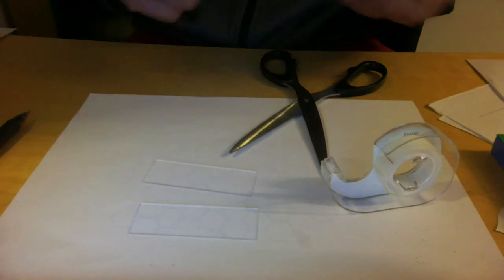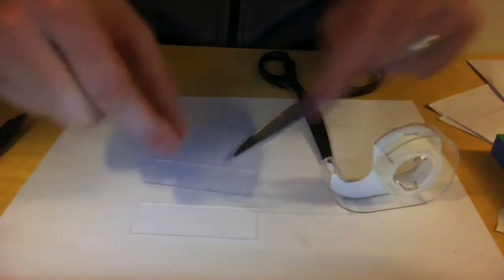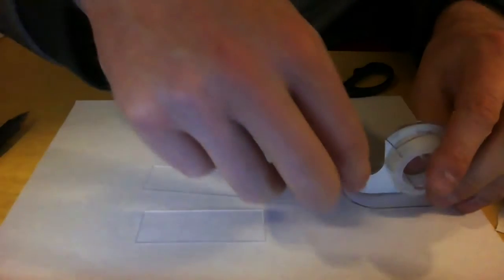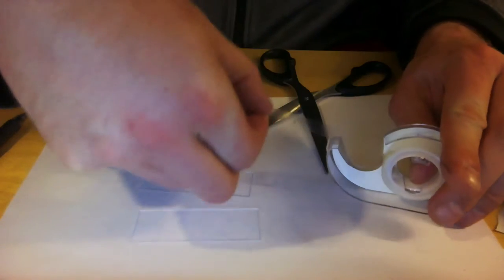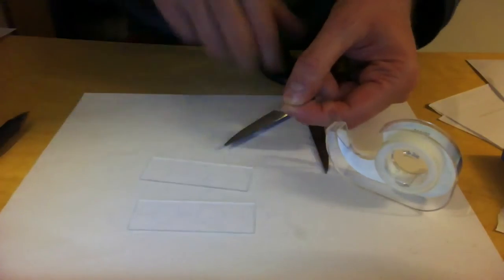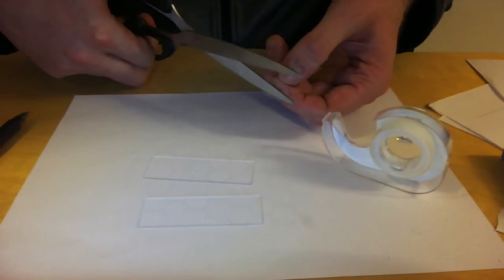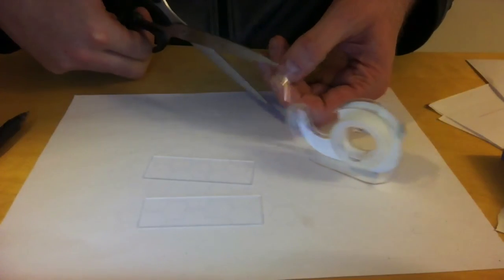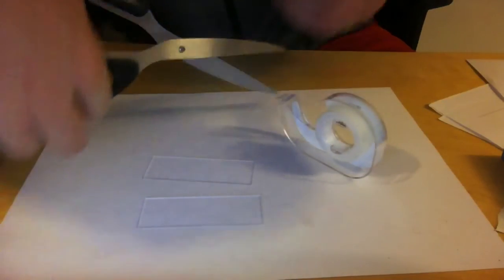So what I'm going to try to do is take a little bit of tape, cut a little slit in the tape, and then tape it on the glass piece, and then put the other glass on top. So let's see if that works. I take a small piece of tape. I'm not very handy, unfortunately, but let's see how far we get. I'm going to cut a little channel in here. And I cut this off. So, I've cut the groove.